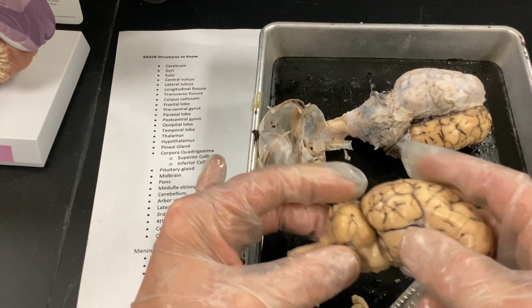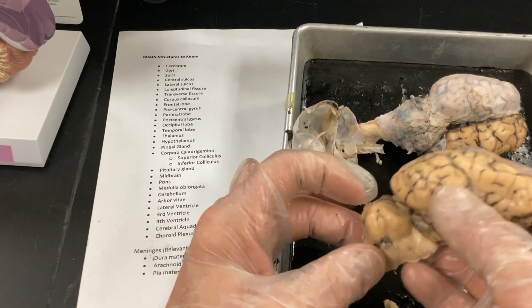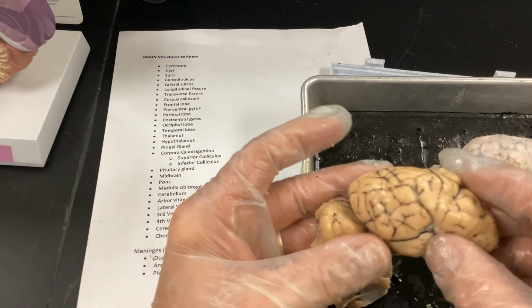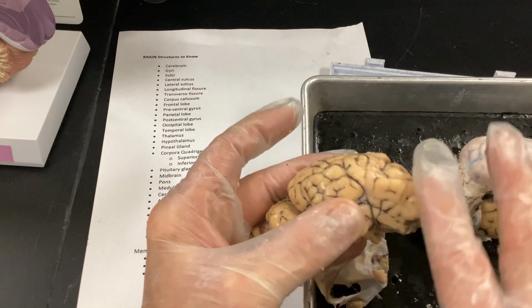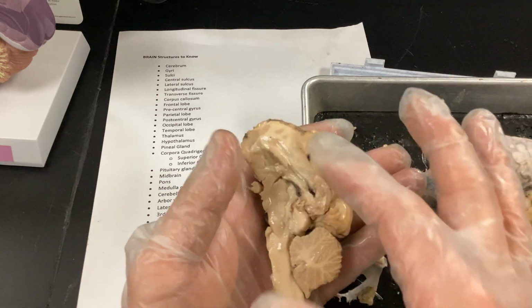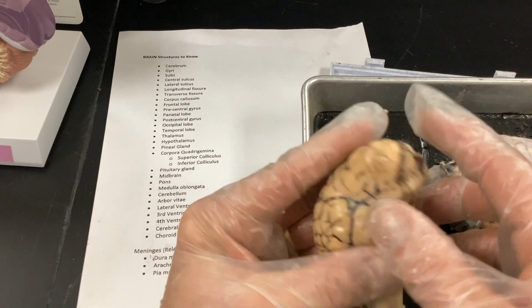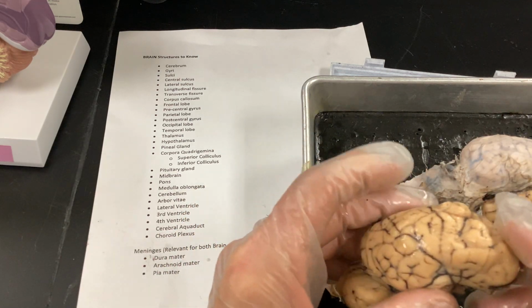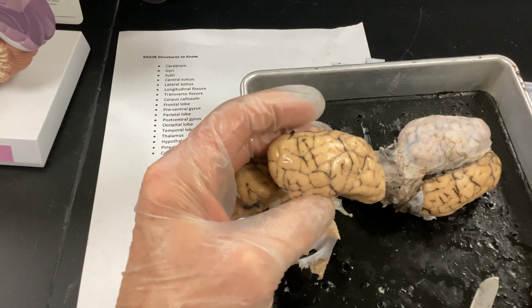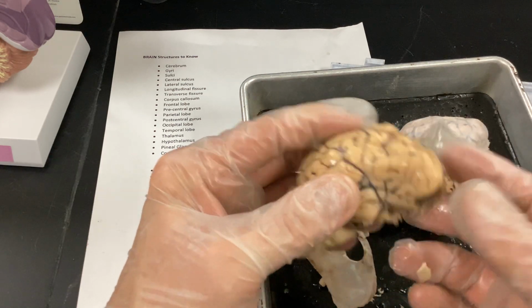All right, so let me go through all this. I'm going to grab the list and kind of go down. So I'm working around this camera here. All right, so cerebrum is going to be all this area here. Cerebrum is the most developed part, the newest part of the brain. Neocortex is another name they could use for it. These are all cell bodies. All right, and we mentioned in lecture cell bodies were for really processing. So it's going to be your higher cortical region for your executive functions.